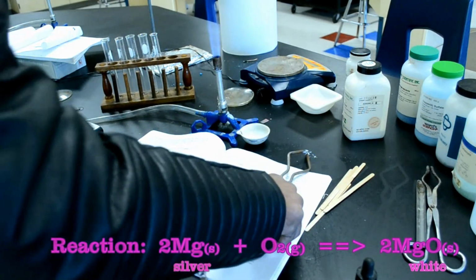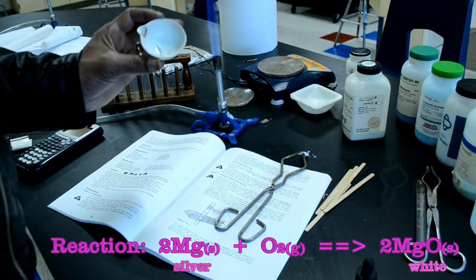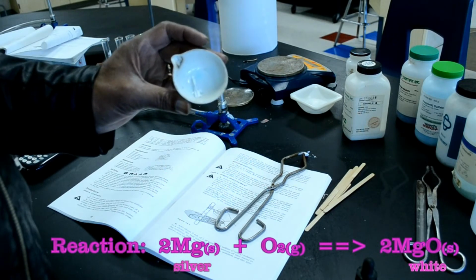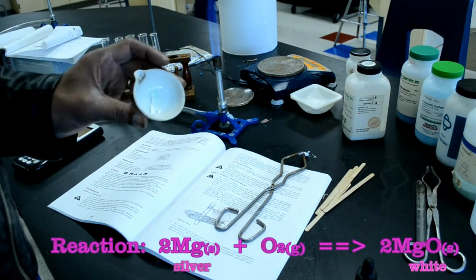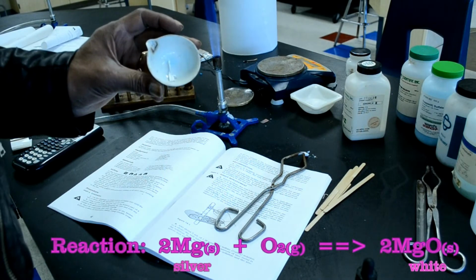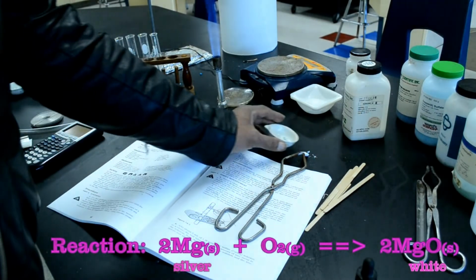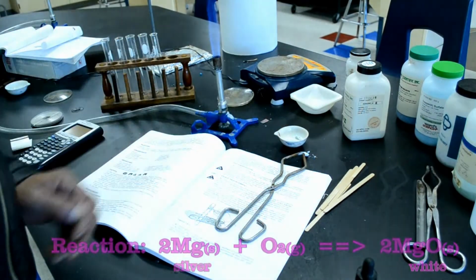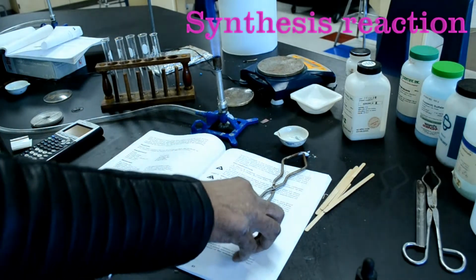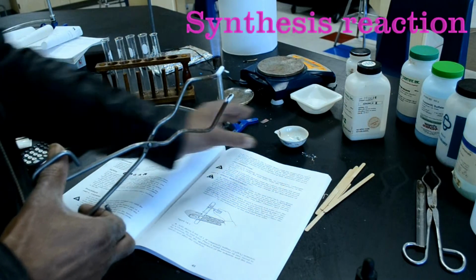Okay, so basically, magnesium has reacted with oxygen to form a compound called magnesium oxide. Magnesium was silver color, magnesium oxide is white. Both of these reactions with the copper and the magnesium represent a synthesis reaction where oxygen was a reactant.